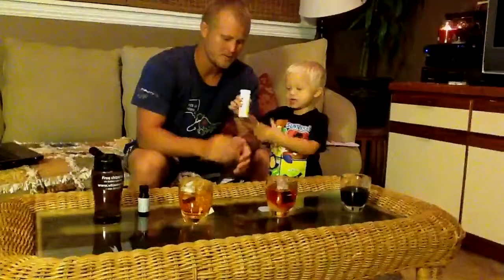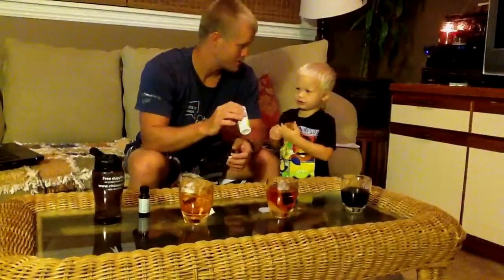So we're going to put them in, one without cornstarch and one with cornstarch, both in the same solution of iodine and water. We're not doing glucose because it's too complex. We let it sit for a while, and we could do an activity of some sort, a worksheet, going over passive transport, simple diffusion, osmosis, and things of that nature.